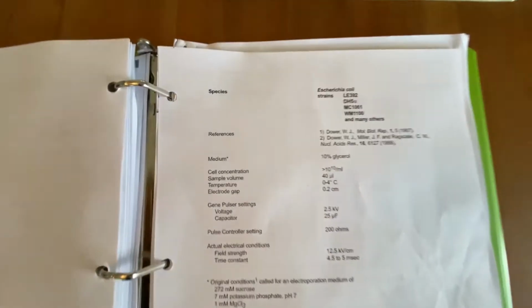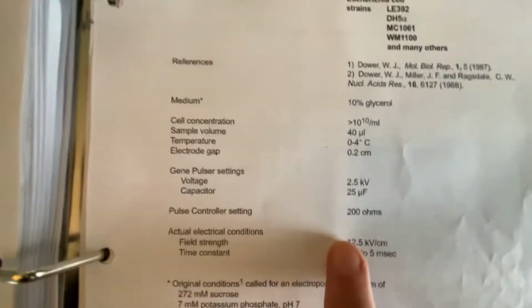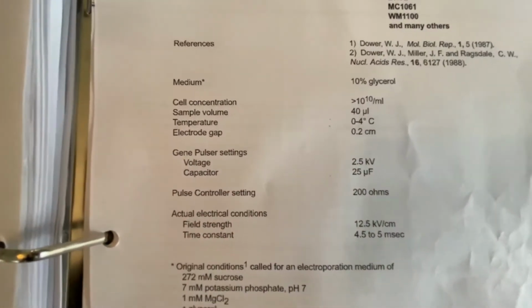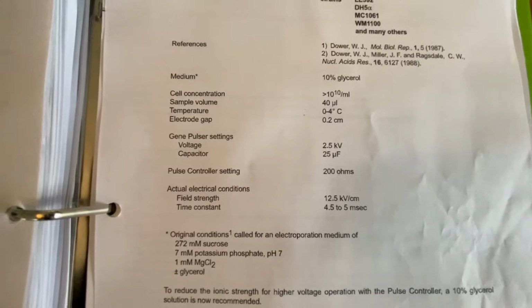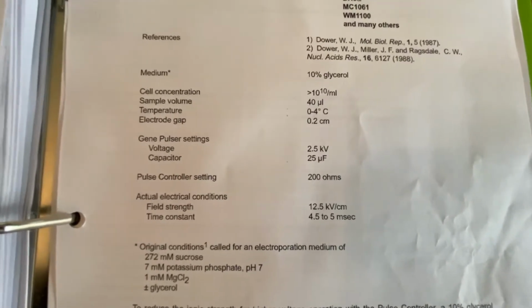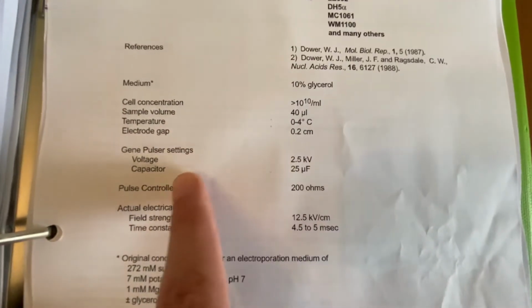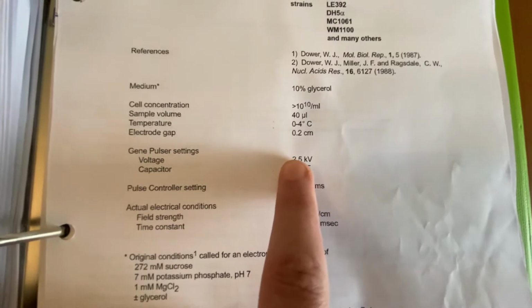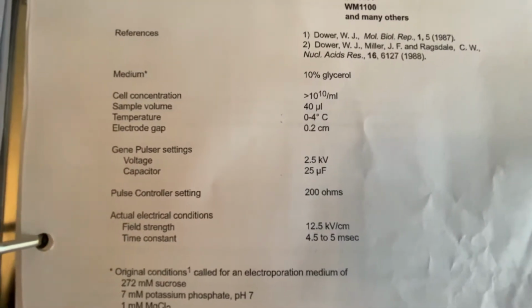Then if we turn to this other one, it says to use 1250 volts, which is 1.25 kilovolts. And then if we turn to the documentation that came with the electroporator, in fact, it even mentions DH5 alpha, and it says to use 2.5 kilovolts. So we have 3 protocols calling for variable voltage ranging from about 1.2 kilovolts to 2.5 kilovolts. Luckily, everything else is the same, the capacitance and the pulse controller setting. But I have read that the higher the voltage, the higher the transformation rates.